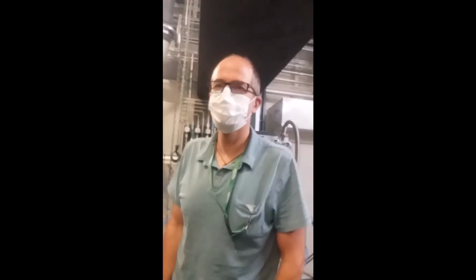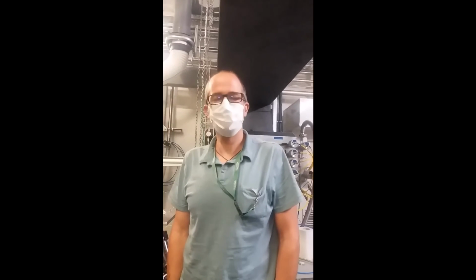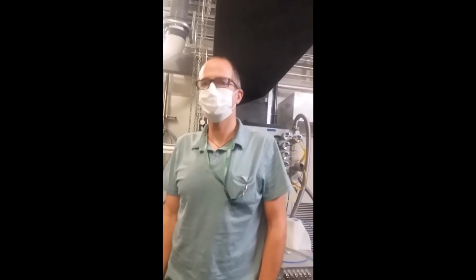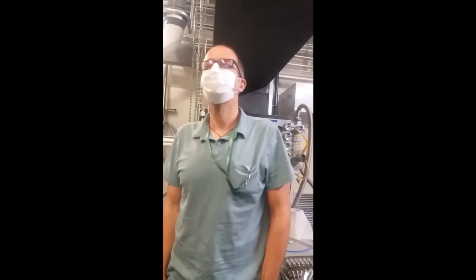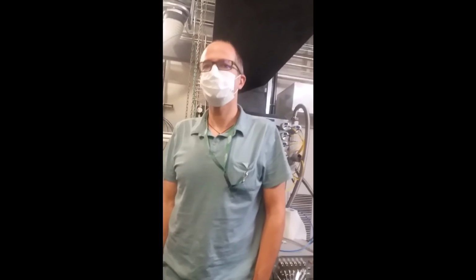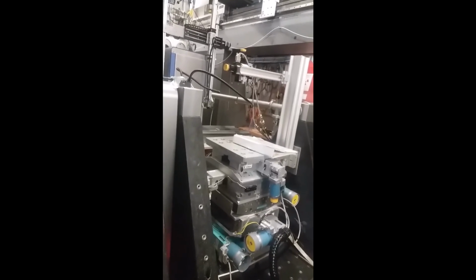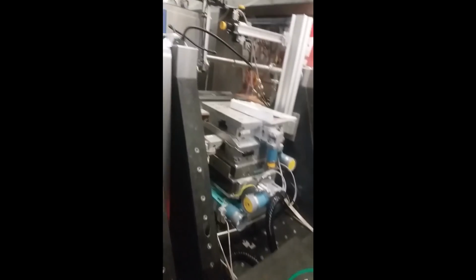So Jakub, the people who are going to see this video are from the conference workshop on additive manufacturing. So they're going to be very interested in what we do with metallurgy. You say high energy beamline. This means for me that it is ideal for metallurgy. So how high is high, and basically this is the station that they're supposed to use if they want to do some in situ experiments.